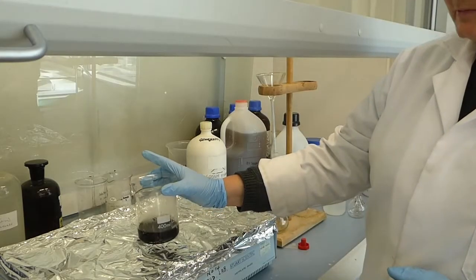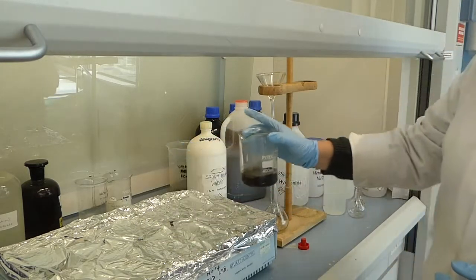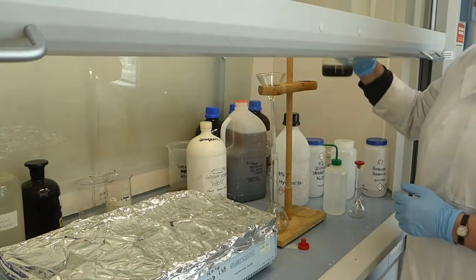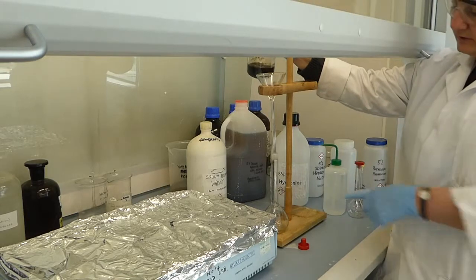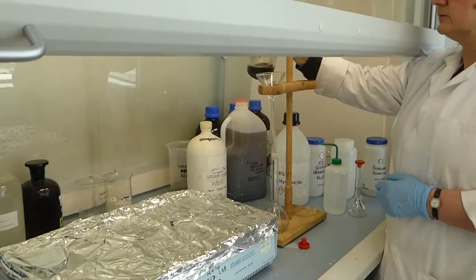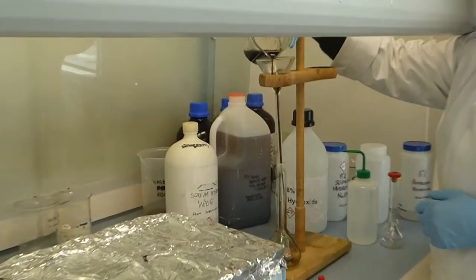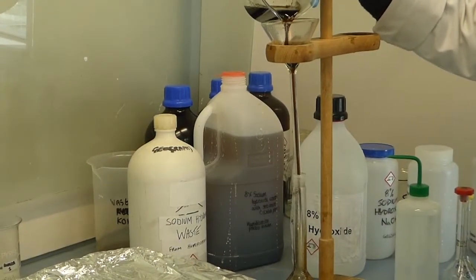After an hour, remove the solution from the hot plate and then pour all of it into a 200 ml volumetric flask. Use the funnel to do this, making sure that the funnel end is aligned with the top of the flask.